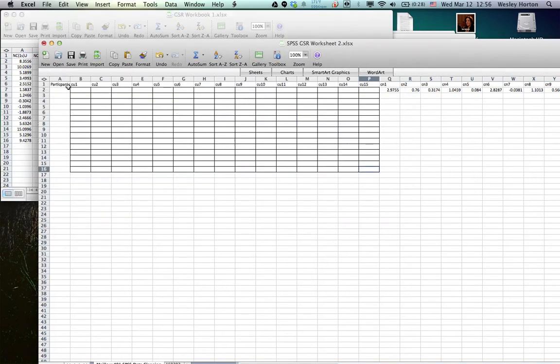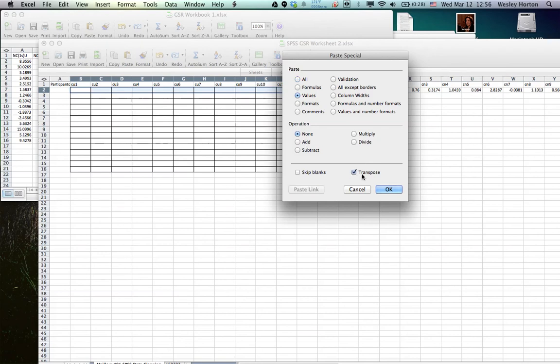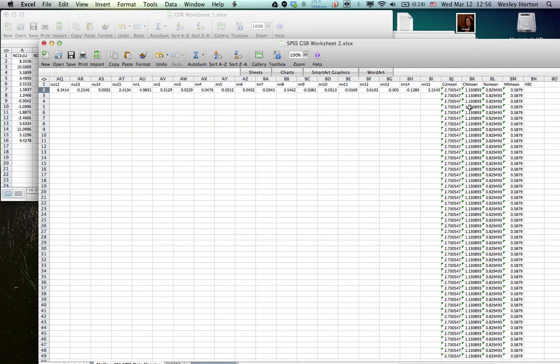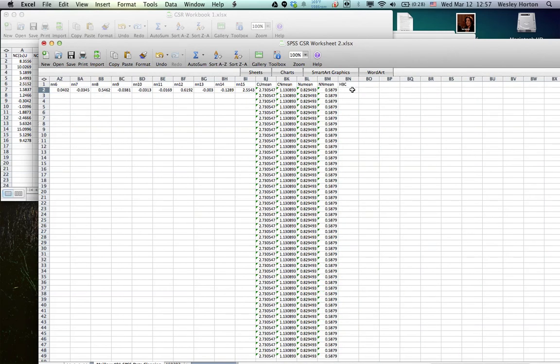Copy. Select. Paste special. Values, transpose. All right, so in the end, this gives me 4 different means for each one. And so it'll just continue based on that part as well. What you go ahead and do as well is whenever you have the information written down on the heartbeat trial thing, you're going to want to put in the heartbeat. So say this person has 0.95, you're going to put that there.